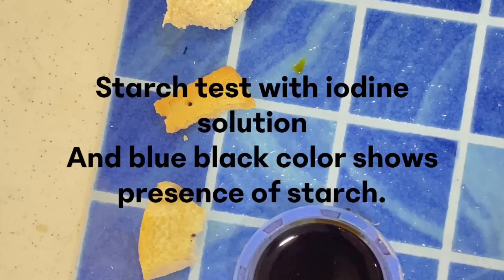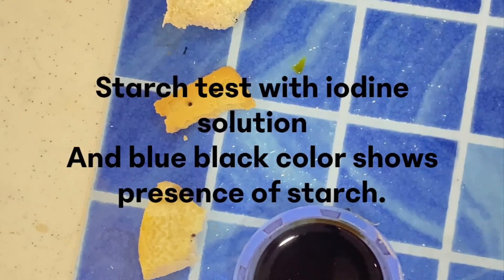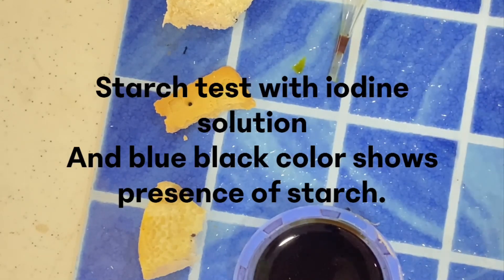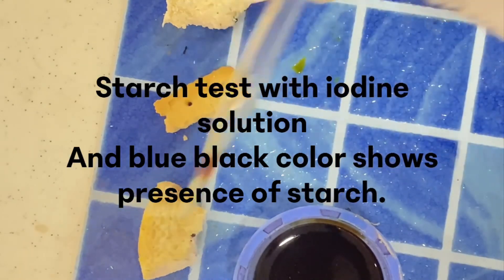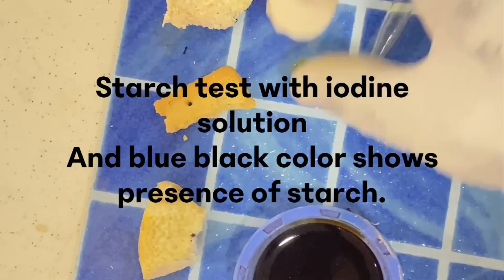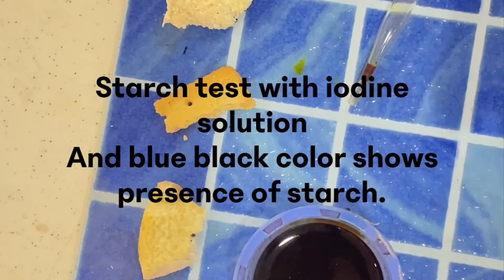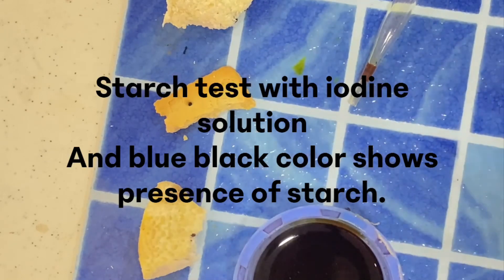Today we are going to do a test for another food substance: starch. Before we do the test, there are some reagents we need. The chemical is iodine solution. We have our dropper here. The food samples are: bread, gari, biscuit, and yam. We are going to add drops of the iodine solution to all the food substances and observe the color change.